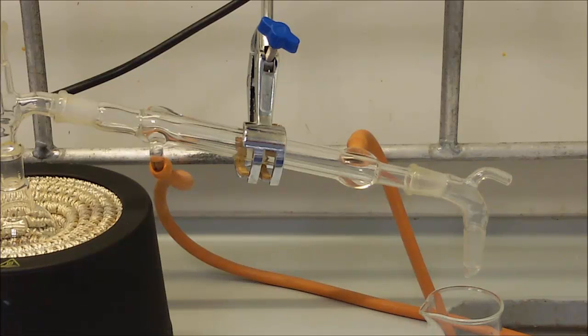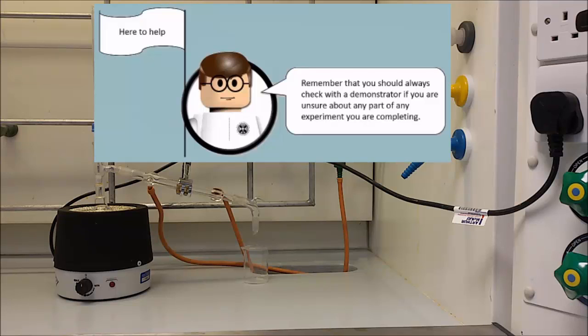Check if the water is not dripping. And ask the demonstrator to check the setup before you switch the heating on.